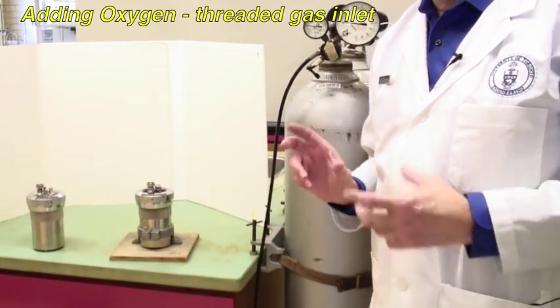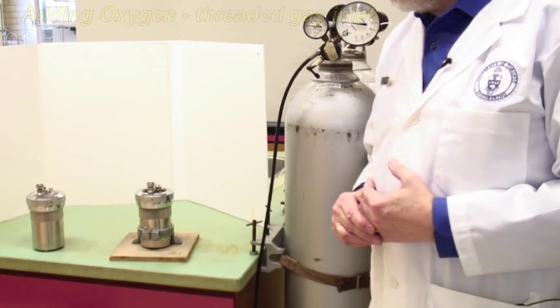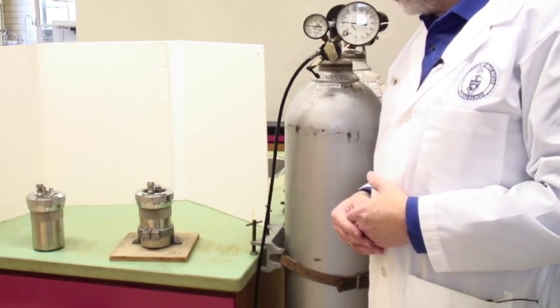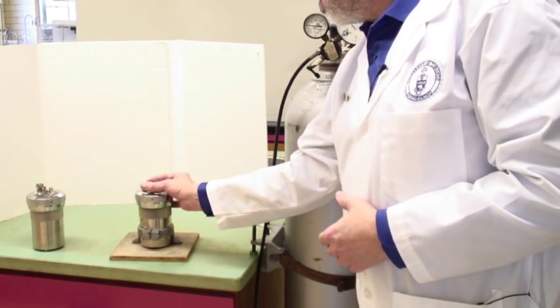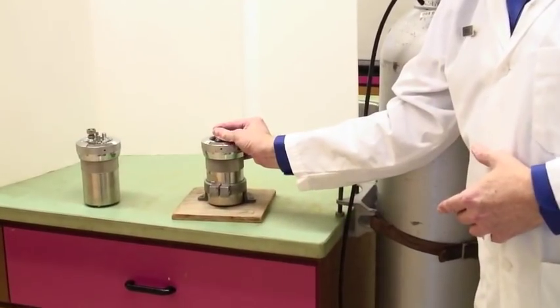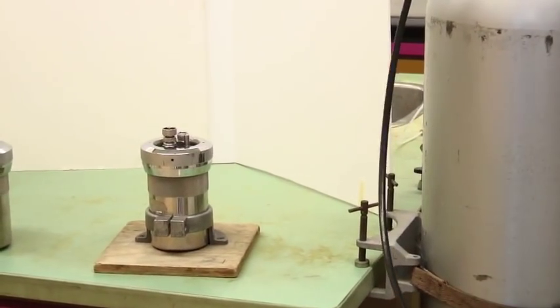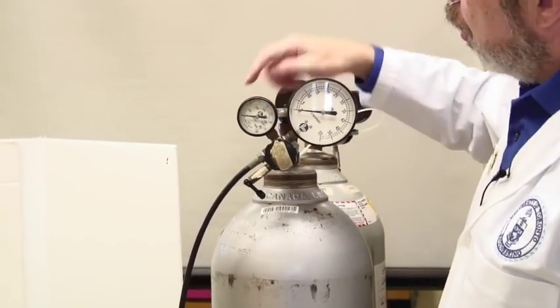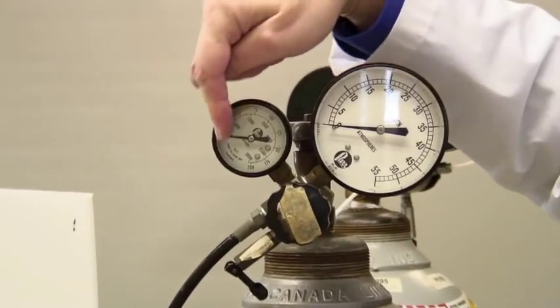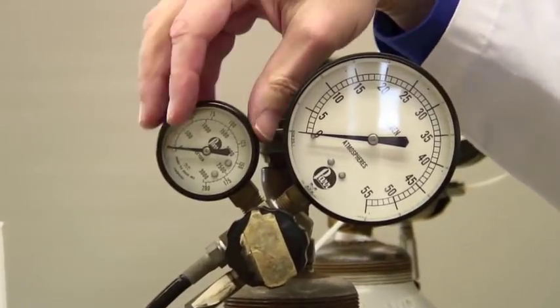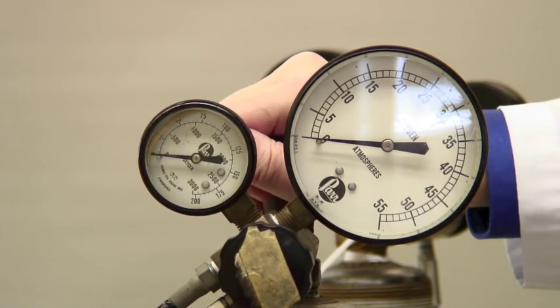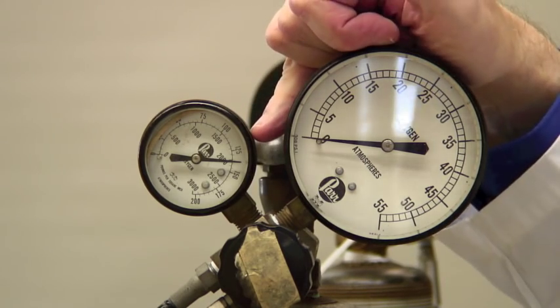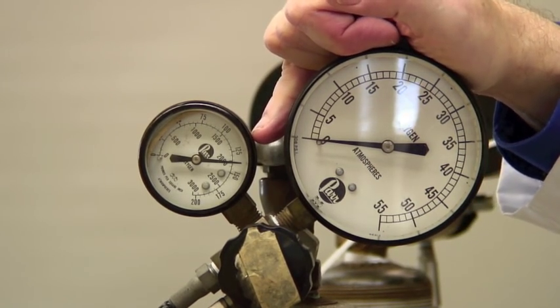A bomb is a pressure vessel, and pressure vessels can hurt you and do significant damage if they let go. So you need to be quite careful with what you're doing when you are applying pressure to this. This is the discharge valve, and so tighten that finger tight. The oxygen comes from a cylinder like this. At the moment it is closed off. If you look at this smaller gauge, it is reading zero. That means that it's not attached to the cylinder. When I open this, righty tighty, lefty loosey, you'll notice that it goes up to about 2,000 psi inside. You probably won't have to open. That'll stay open all day. But if it isn't, obviously that needs to be open.